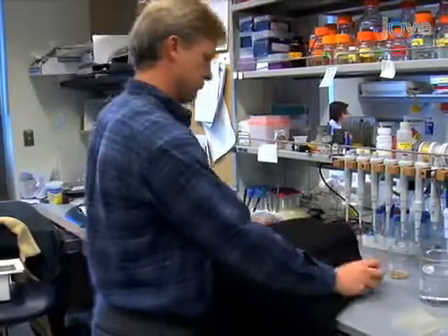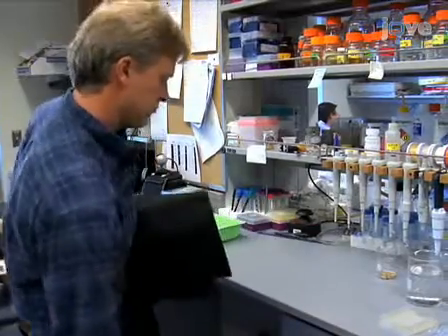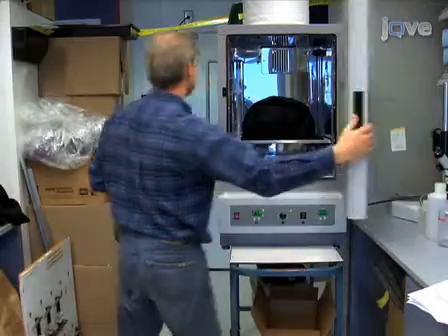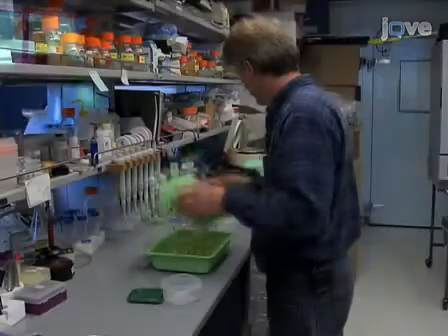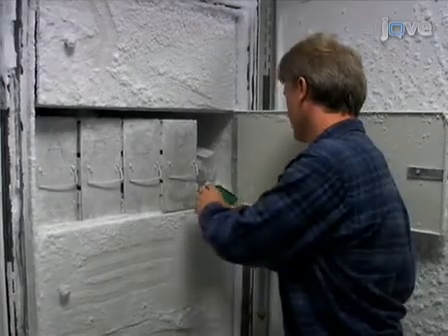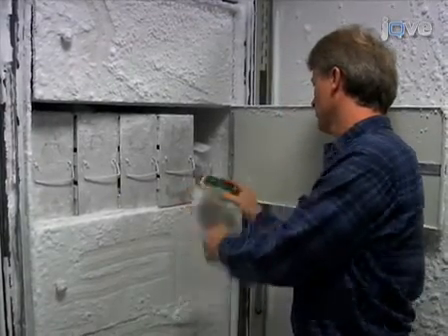Maintaining a dark growth environment is critical, as even small amounts of light affect both the rate of seedling development and the cell wall properties that we measure with this technique. On day 3, you can peek in the box using a dim green filtered light to check on seedling development. Usually, when peeking into the box on day 3 or 4, you will find seedlings grown to about 5 centimeters in length, which is typically what we used for our experiments. These seedlings can be frozen at -80 degrees Celsius before use.